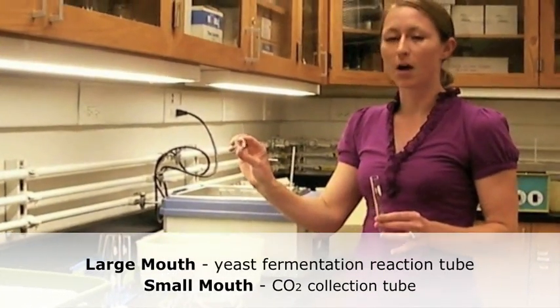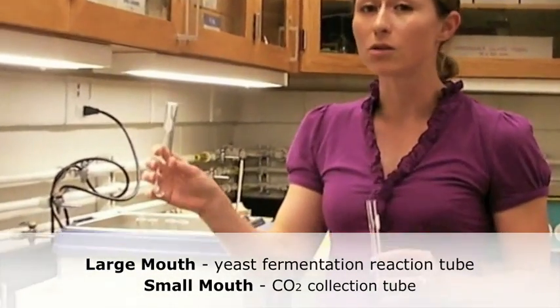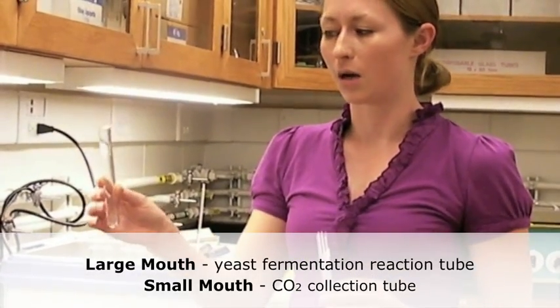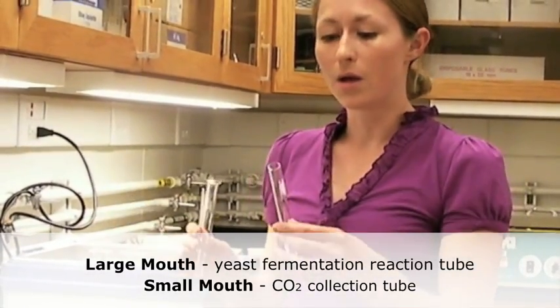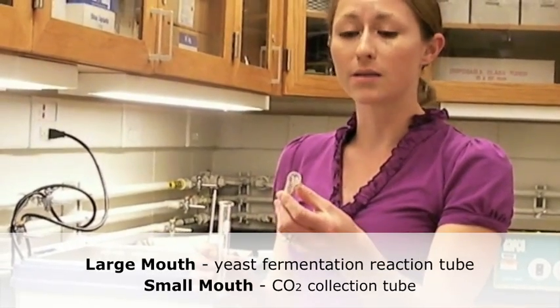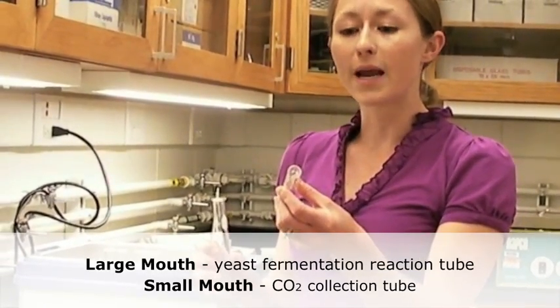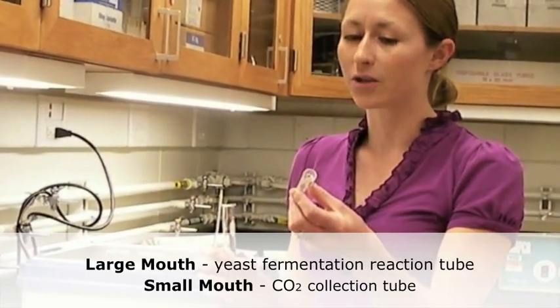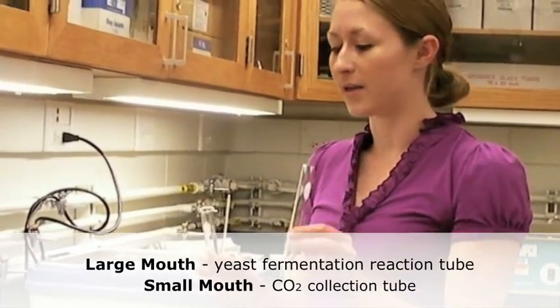One is a large mouth test tube that is the reaction tube, so your yeast and your glucose and any of your test materials are going to go in the larger mouth tube. The regular looking test tube that has a smaller hole is going to be your collection tube, and this is where you will collect the gas from the fermentation reaction through water displacement.